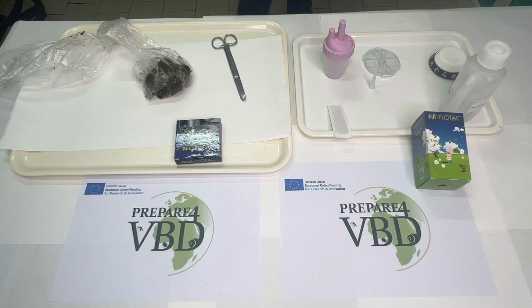And now we have the live demonstration, first of mini-FLOTAC and then on KFM, based on the work performed by my collaborators in the lab. Antonio Bosco and Lavinia Ciuca will start with the mini-FLOTAC live demonstration. So go ahead, please. Hello again.